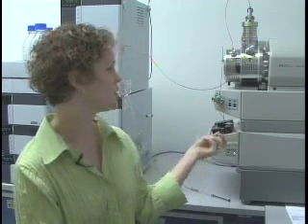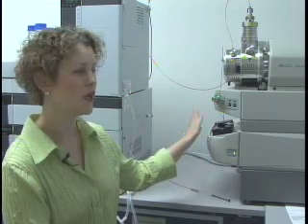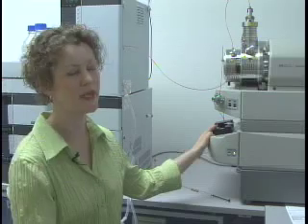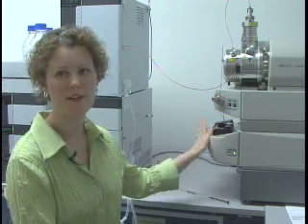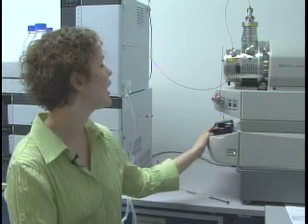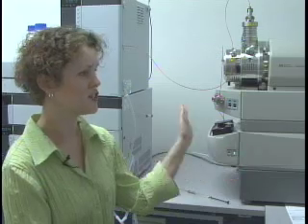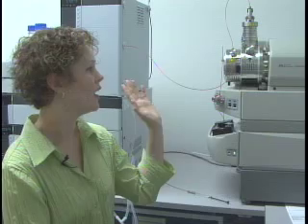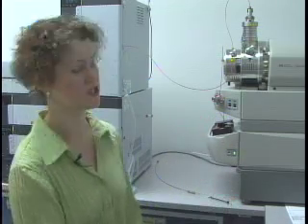What this system is going to do is we're going to use the syringe pump that we've used before. We're going to infuse a diluted solution of whatever analyte you'd like to use. In this case, we're going to use some cocaine standard that we made up. It's about 5 milligrams per liter concentration. We're going to infuse it into the system and run an automated program where it's going to ramp some parameters, and ultimately it's going to spit out a report which lets us know which parameters have been optimized and what those results are.